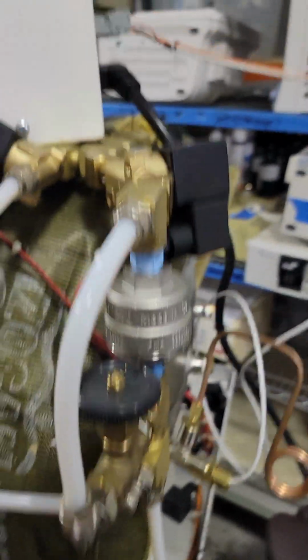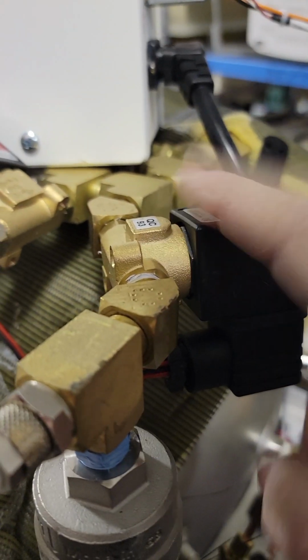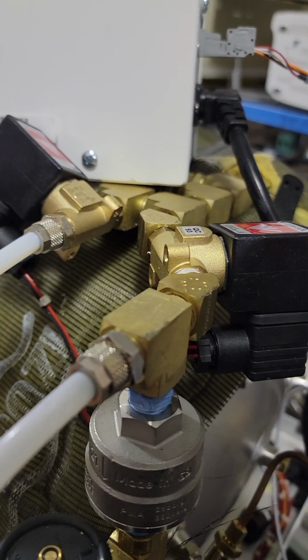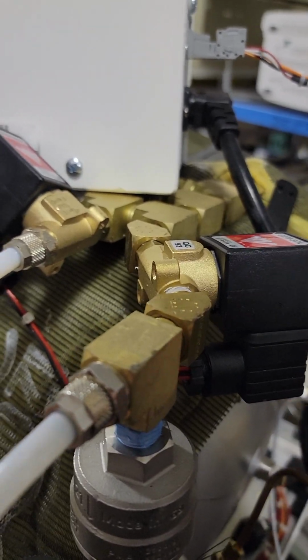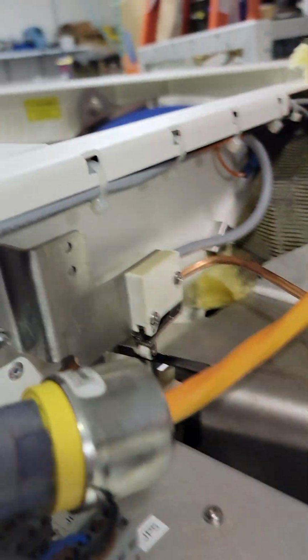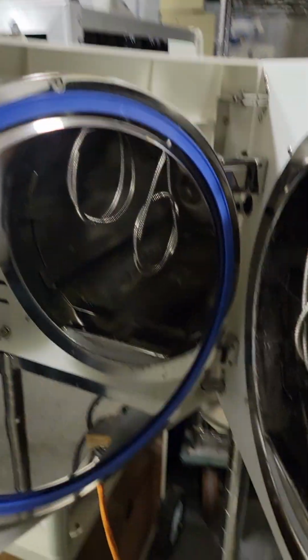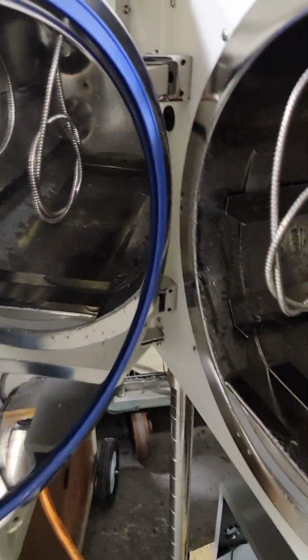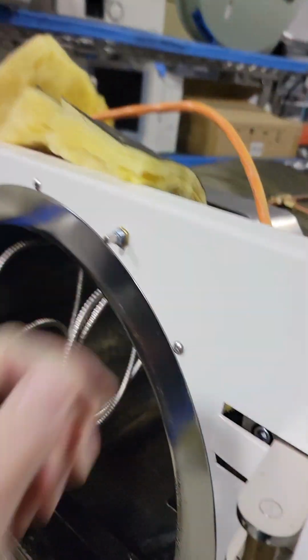Thermal switch. These are 4mm. You're used to regular Tuttnauers having 3mm and 6mm, the little blue and green stickers. These are the yellow sticker. They are 4mm, so you cannot swap them around. Doors way heavier, a very different door gasket, as you can see. Much heavier door. Temp sensors.